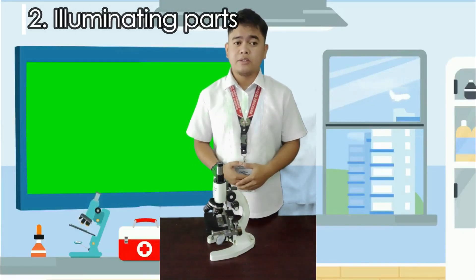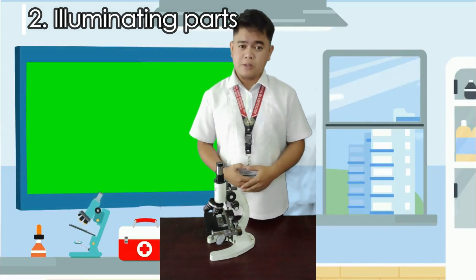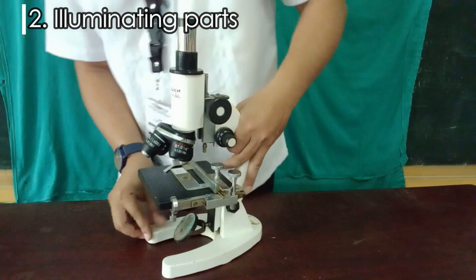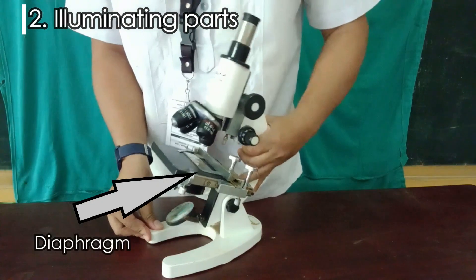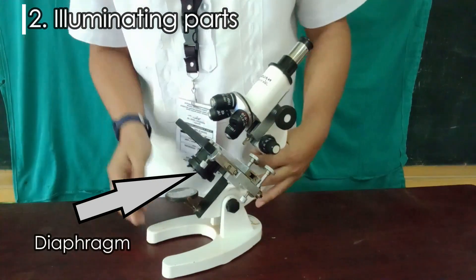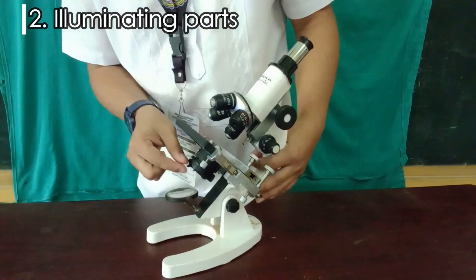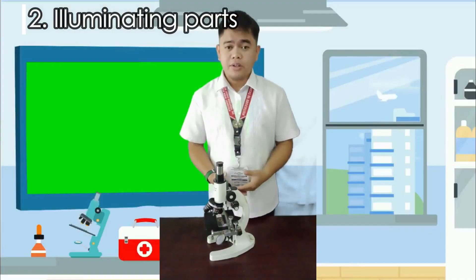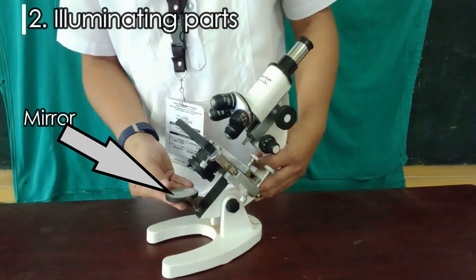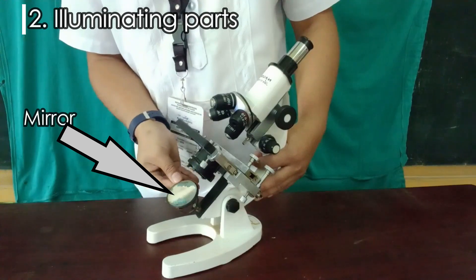Illuminating parts are parts of the microscope which supply and regulate light towards the focused specimen. We have the diaphragm, which adjusts the light that enters the microscope. The mirror is the source of light and reflects light that enters the microscope.